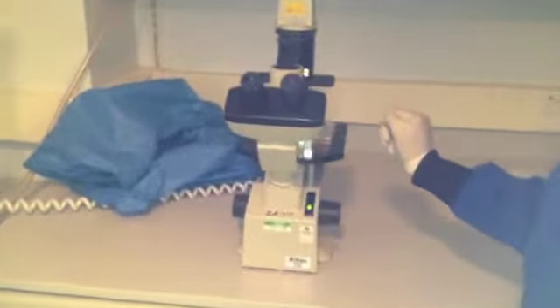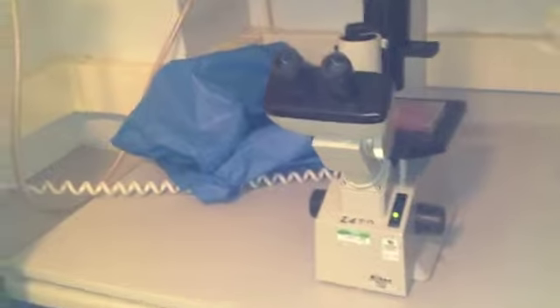And just look under the microscope to make sure that you see some bluish coloration or dark coloration inside the cells.